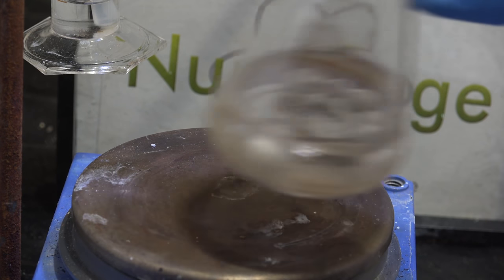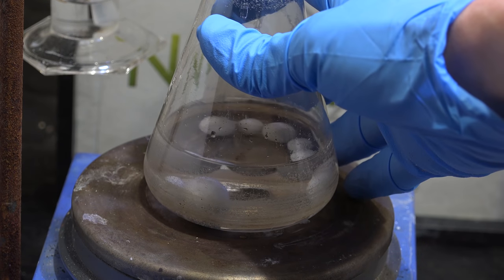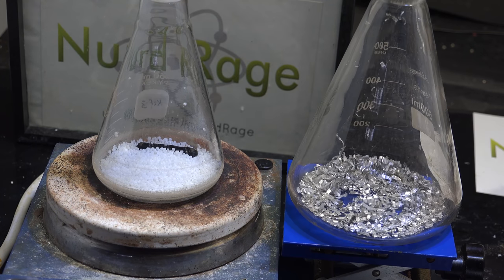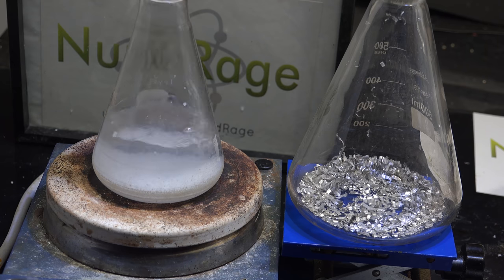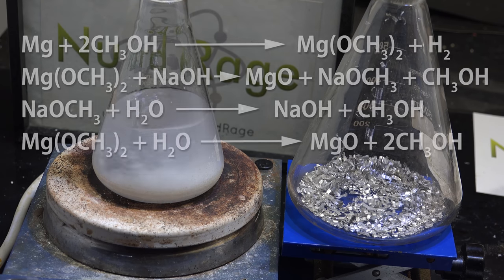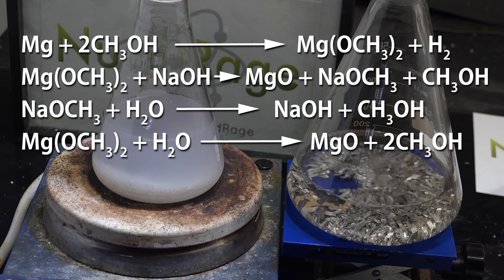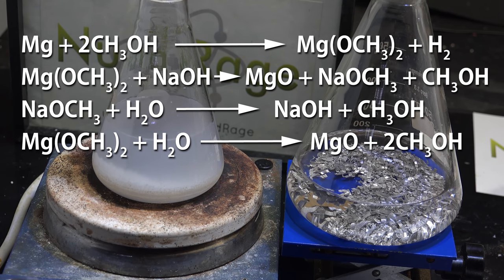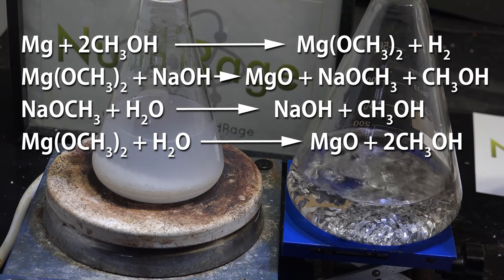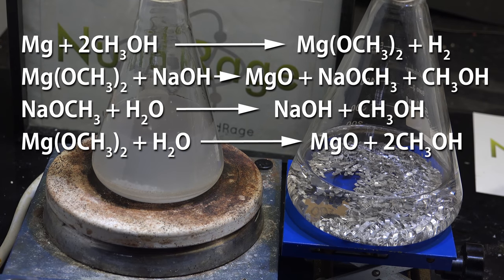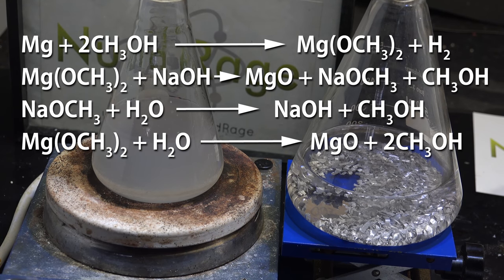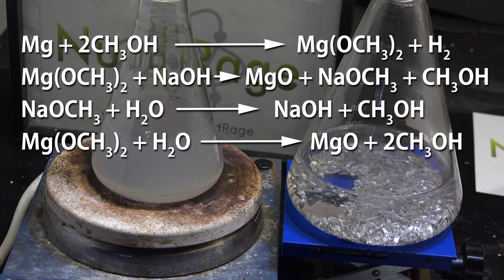Even if it's more expensive and cumbersome all we need is an initial jumpstart. So my first idea was a rather crazy one and that was to dissolve a small portion of magnesium in methanol and make magnesium methoxide and then use that to react with a small portion of sodium hydroxide in methanol. Overall what would happen is that we'd make a mixture of magnesium oxide and sodium methoxide and this in turn could be used to consume the water in a larger portion of sodium hydroxide.